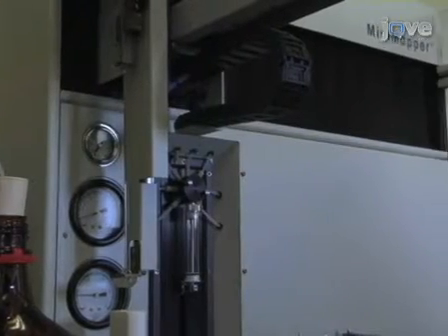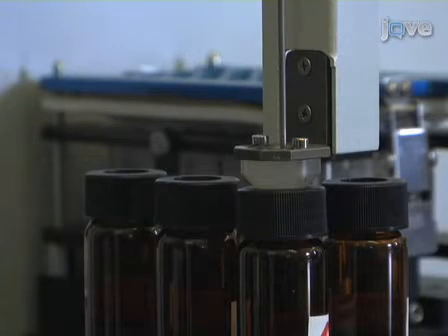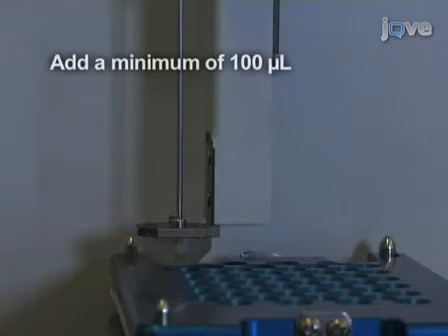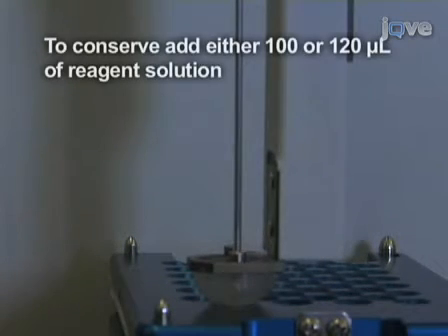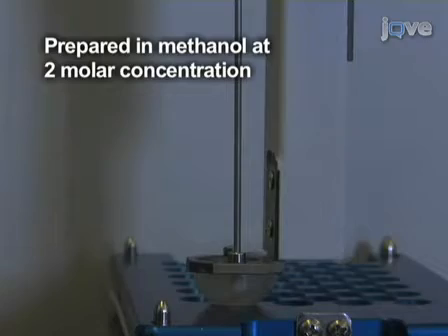The liquid handler uses a robotic arm equipped with a syringe and can deliver any source to any destination on the rack using the syringe pump. The current setup uses a 10 milliliter syringe that can accurately deliver a minimum of 100 microliters. To conserve reagents, add either 100 or 120 microliters of each reagent solution, prepared in methanol at 2 molar concentration.